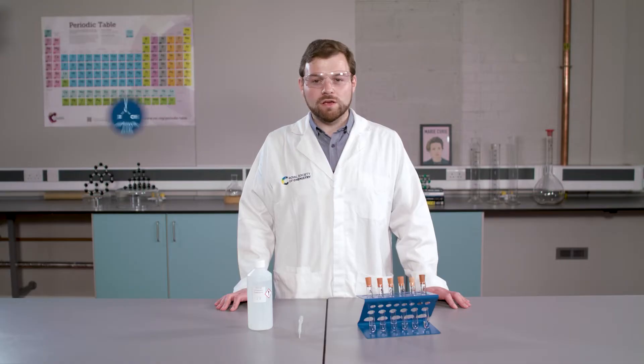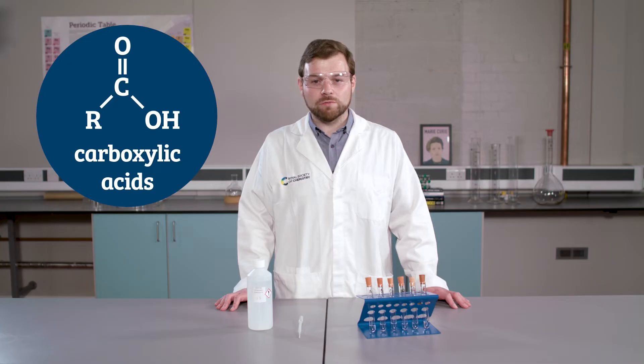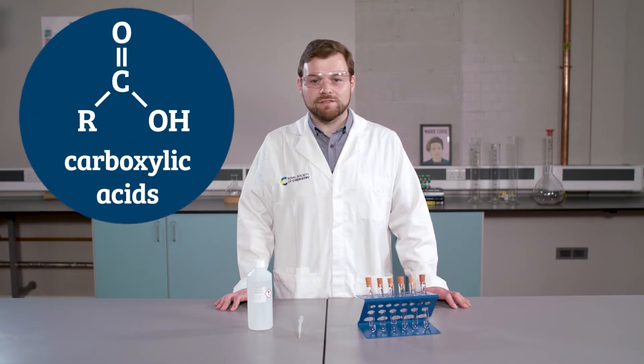The first test we are going to do is for the carboxylic acid functional group. There are many tests for acids, some which you may already be familiar with. However today, we are going to use the metal carbonate test.